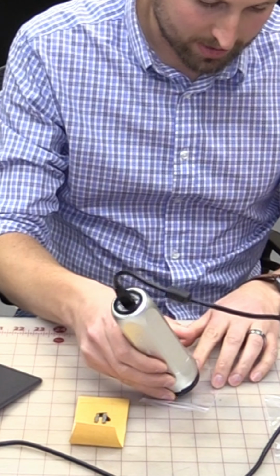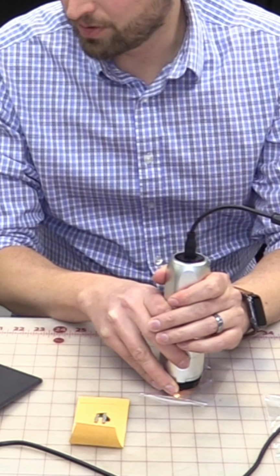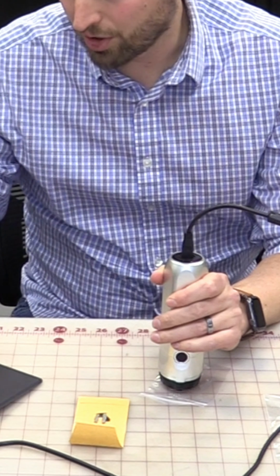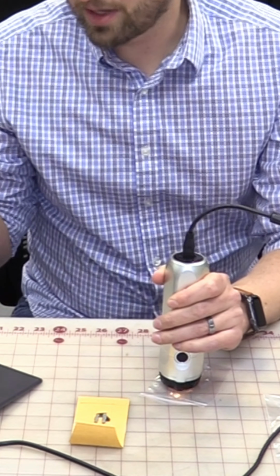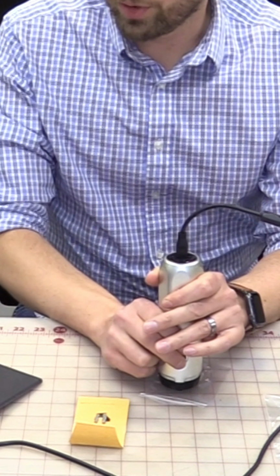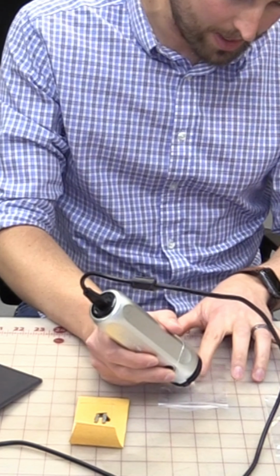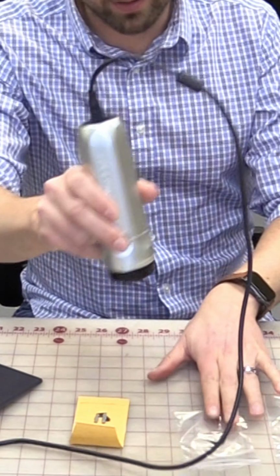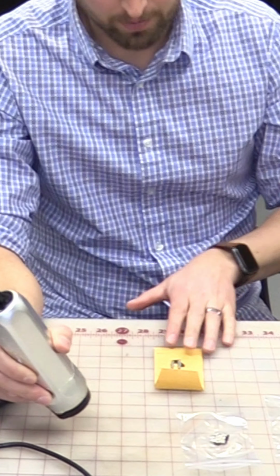And that's true across the entire surface of this side of the fusible link. You can see down here we've got all of these curves and soft edges. So this is exactly as we would expect, and now we have a really good comparison piece for an over temperature event. And then finally we have our subject. This is the fusible link that was actually collected from the scene.